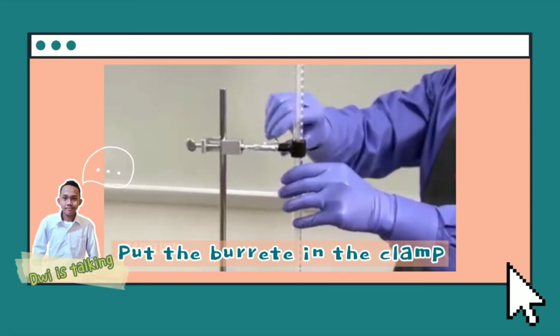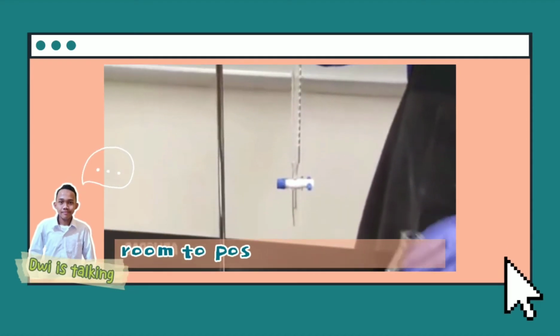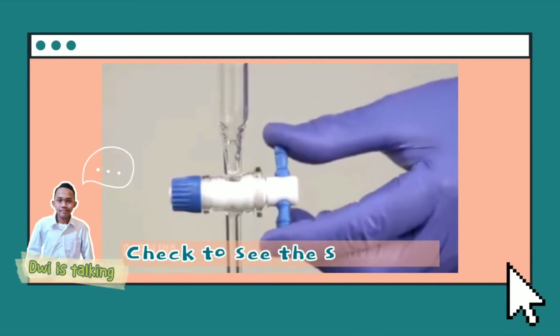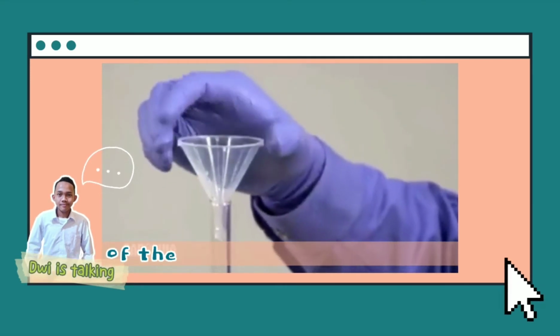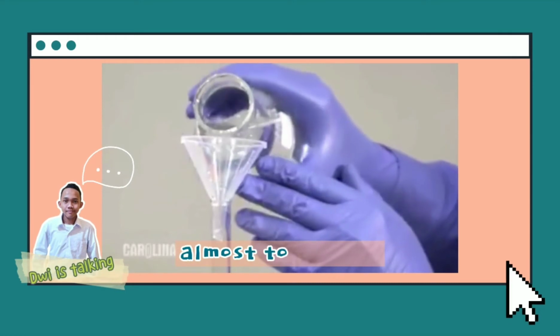Put the burette in the clamp, making sure it is positioned vertically and there is enough room to position your flask under the tip. Check that the stopcock is in the closed position. Insert the funnel into the top of the burette and fill with sodium hydroxide as the titrant almost to the top.